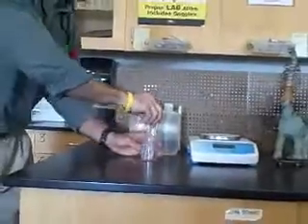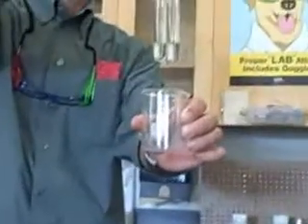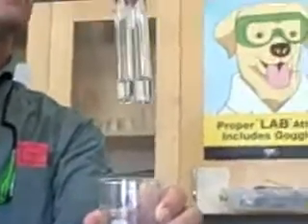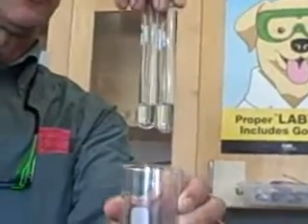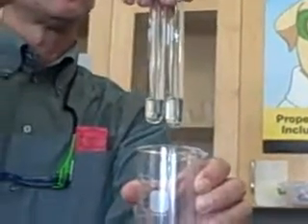So now, our qualitative observations before the reaction would be what? What do we have here? Kyle? Two clear liquids. Two clear liquids. You can stop that.